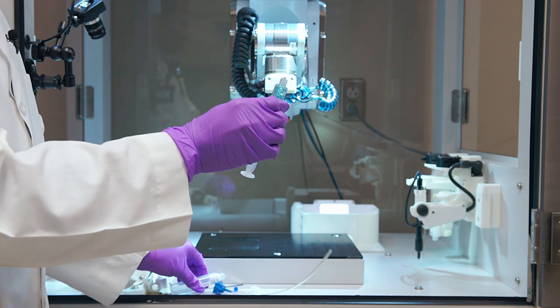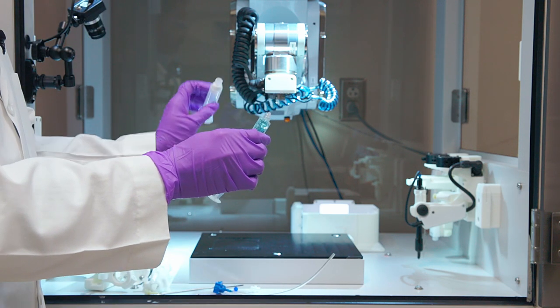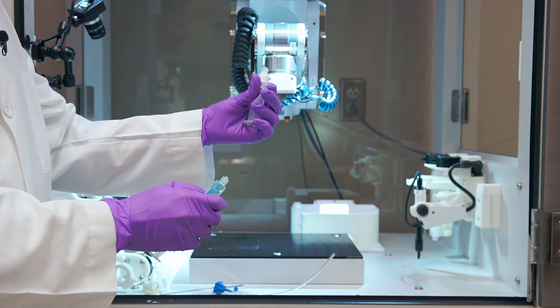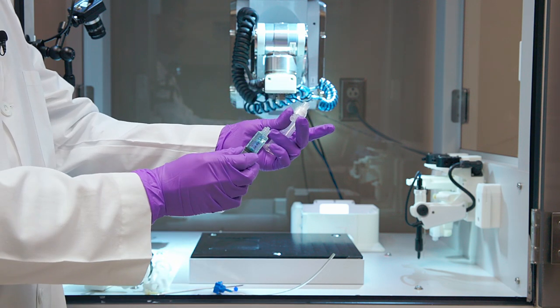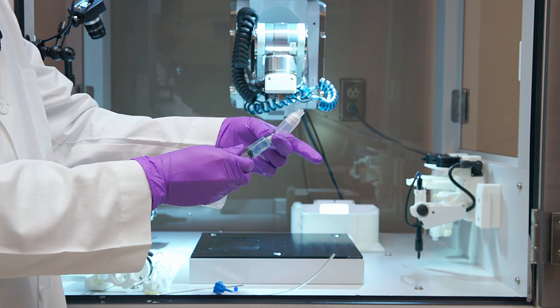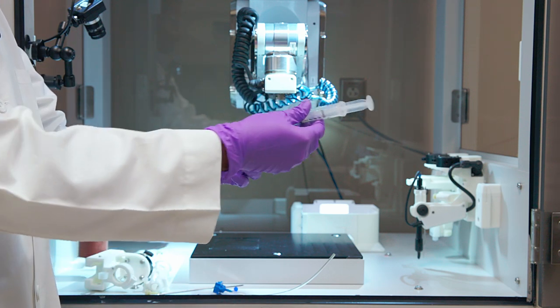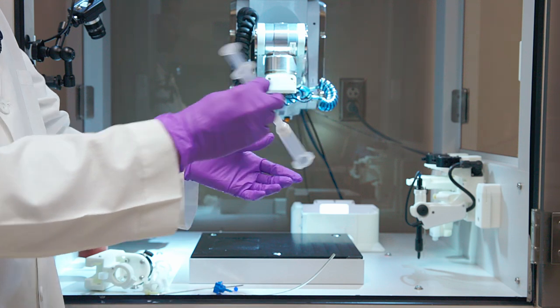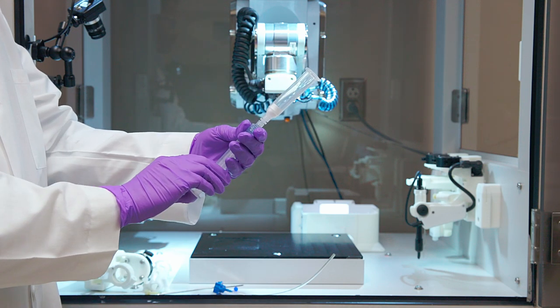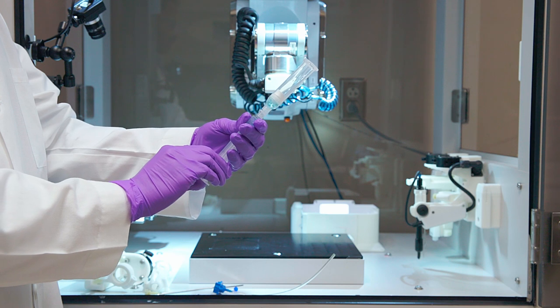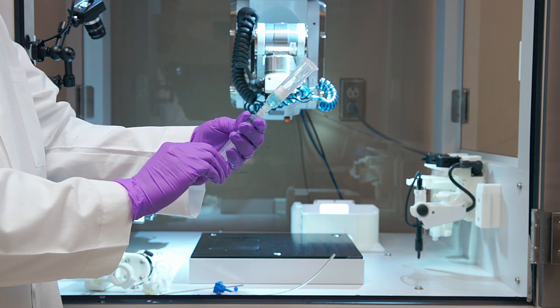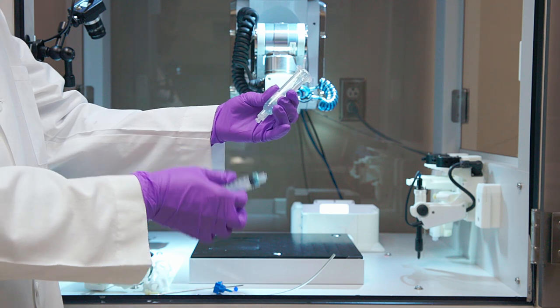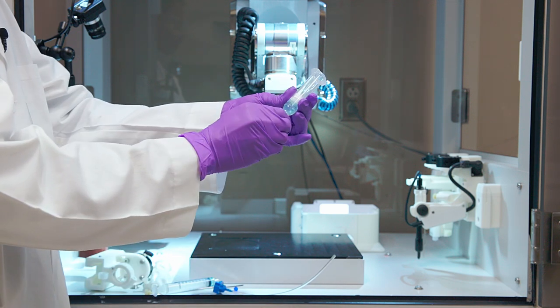We will be transferring the contents of the syringe into a 10 cc syringe using a female to female luer lock adapter. Insert the adapter into the syringe, and on the other end, insert 10 cc syringe. Now push the plunger until the ink is transferred into the 10 cc syringe.